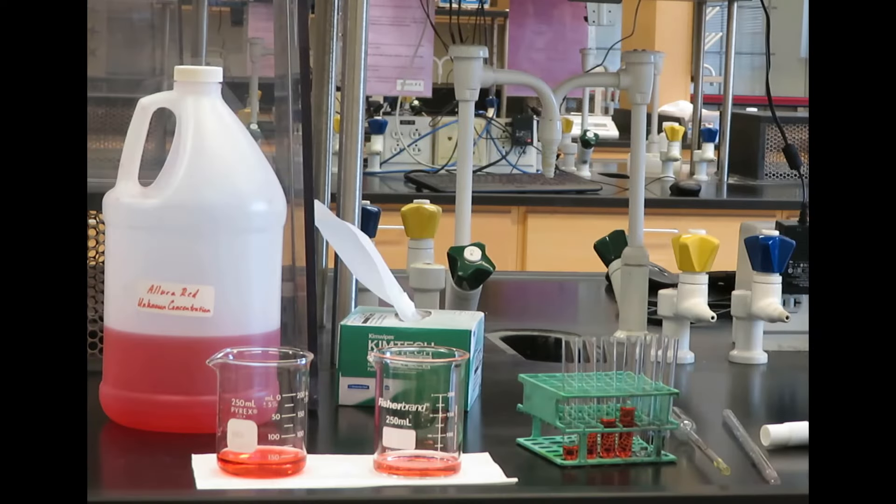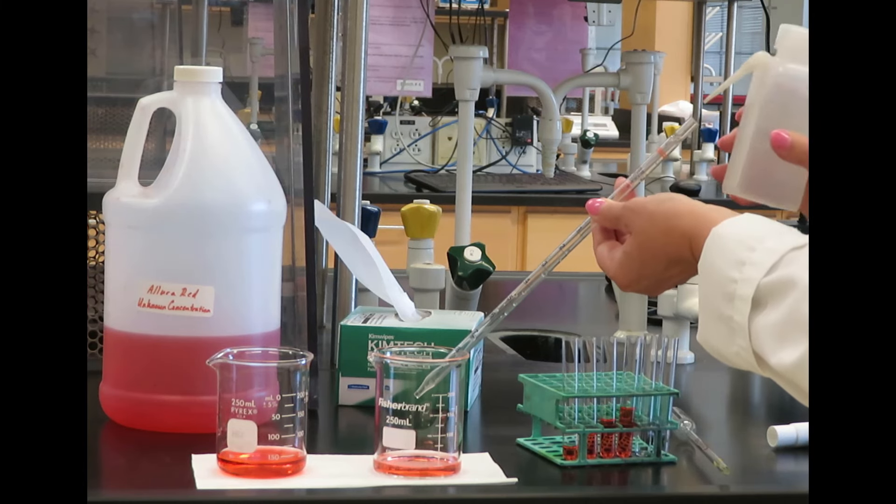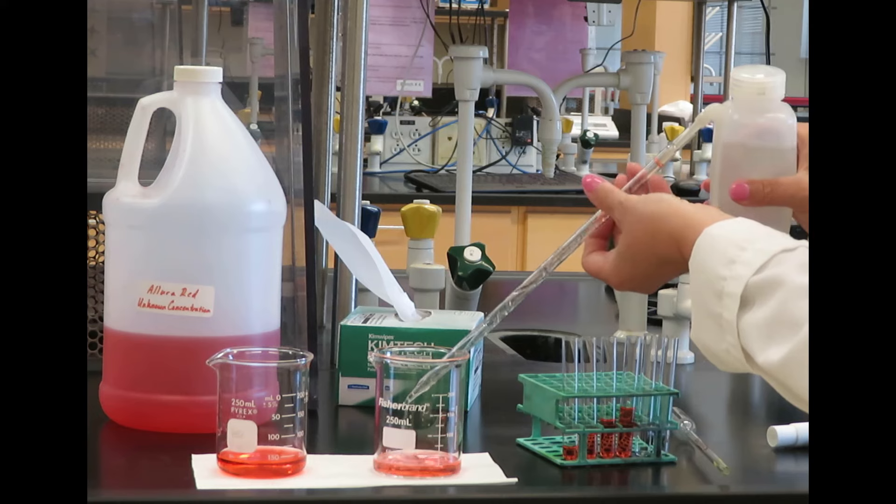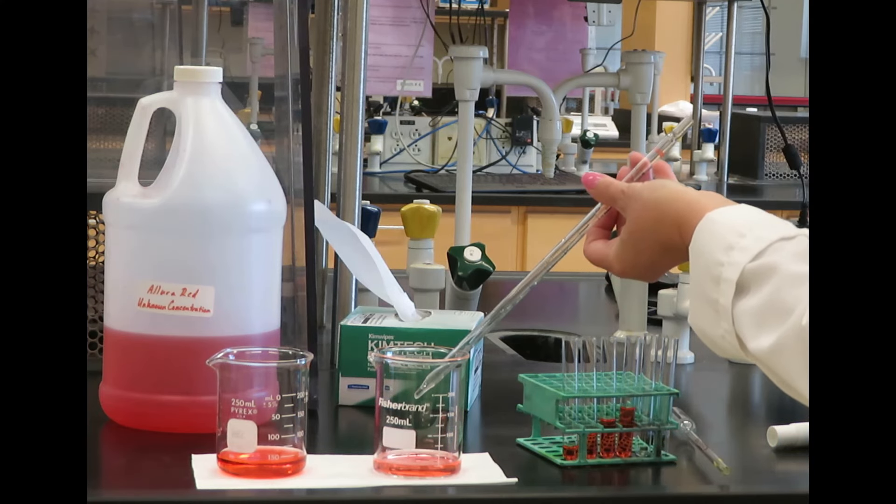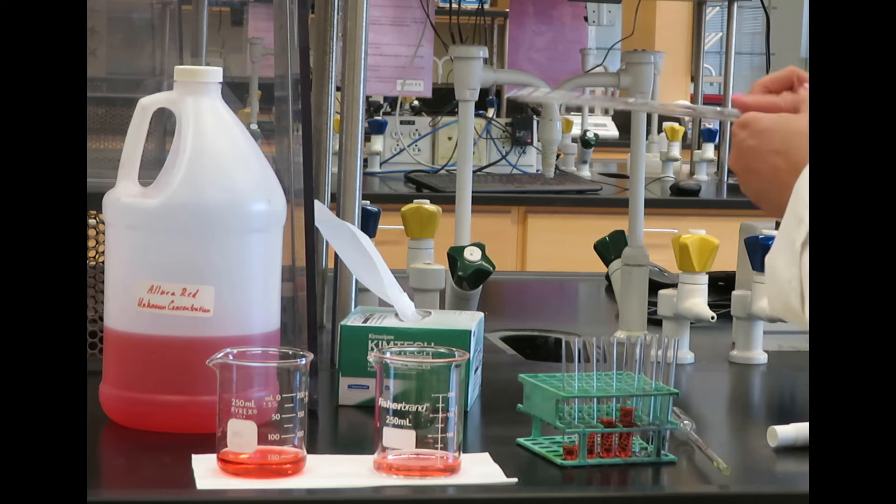Finally, when you are done with the experiment, make sure to clean out the pipette with deionized water. We take the pipette, place it over the waste beaker, and use our squirt bottle to rinse all around. Give it a little shake, and you're done.